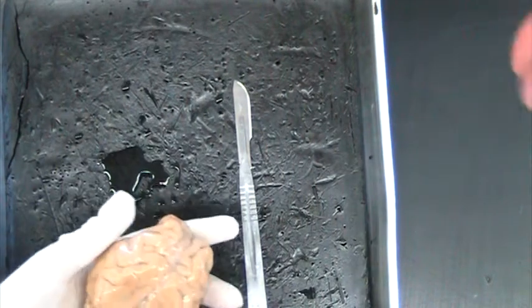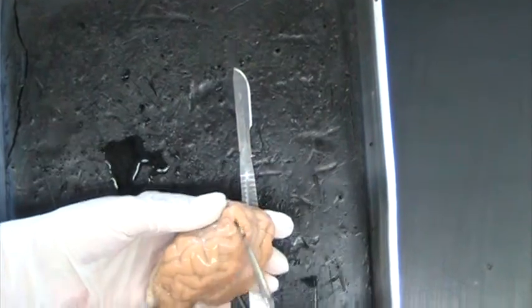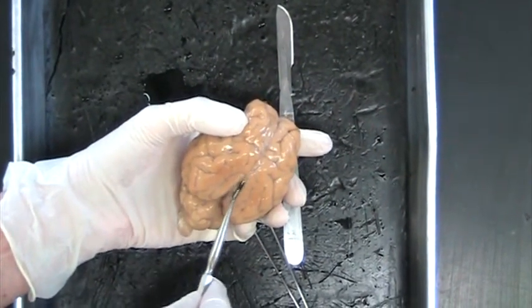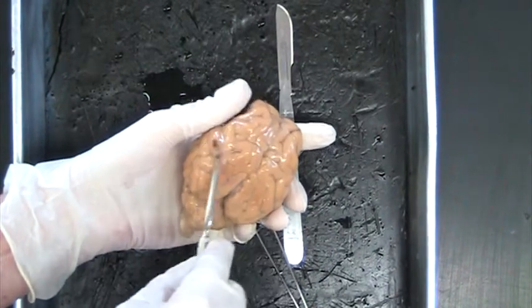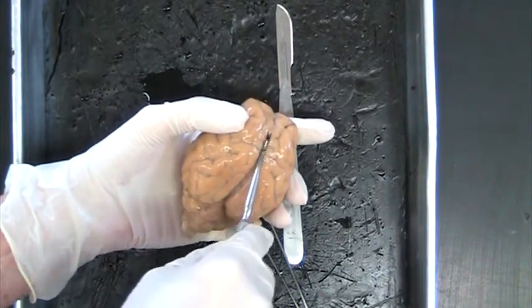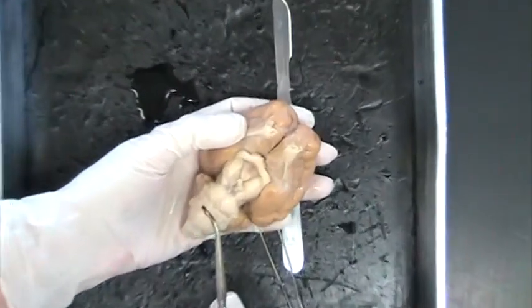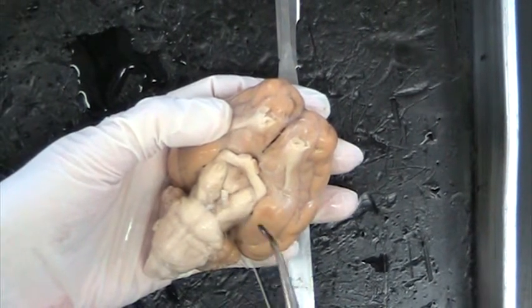No, I'm kidding. Okay, so if we look at the brain, here again, the large part of the brain is the cerebrum, and the hindbrain, or the little part, is the cerebellum. And the three-layer meninges, you can't really see it, but it's kind of a membrane that wraps the whole brain and the spinal cord also. So first the outer coating is the meninges. But then if we look at the base of the brain, some of the parts that I would like you to take note of are the nerves. And of course your spinal cord comes up, your brain stem again, and then it comes up to different nerves.